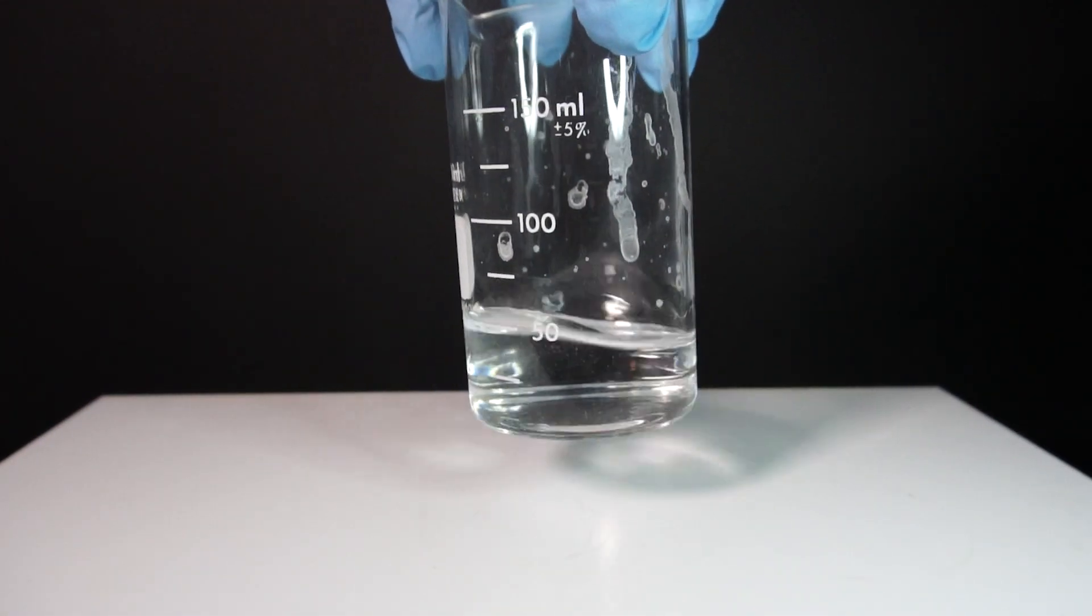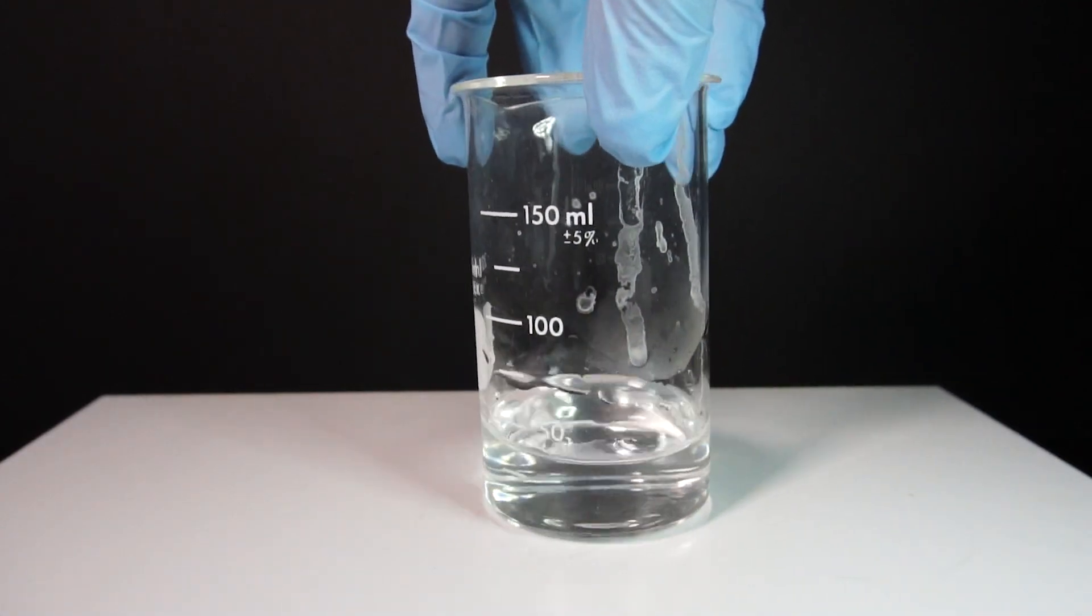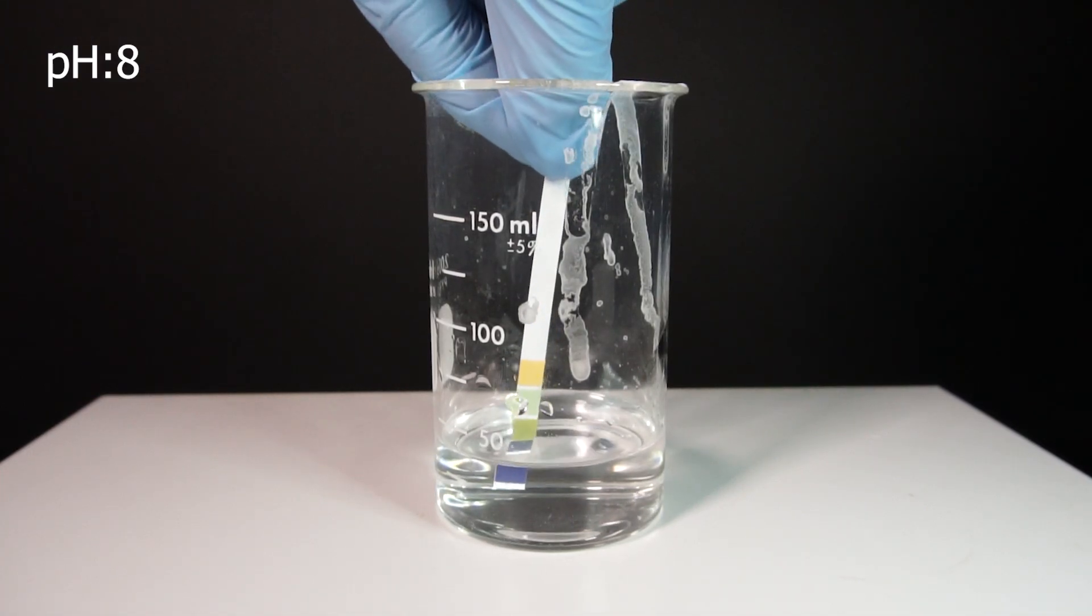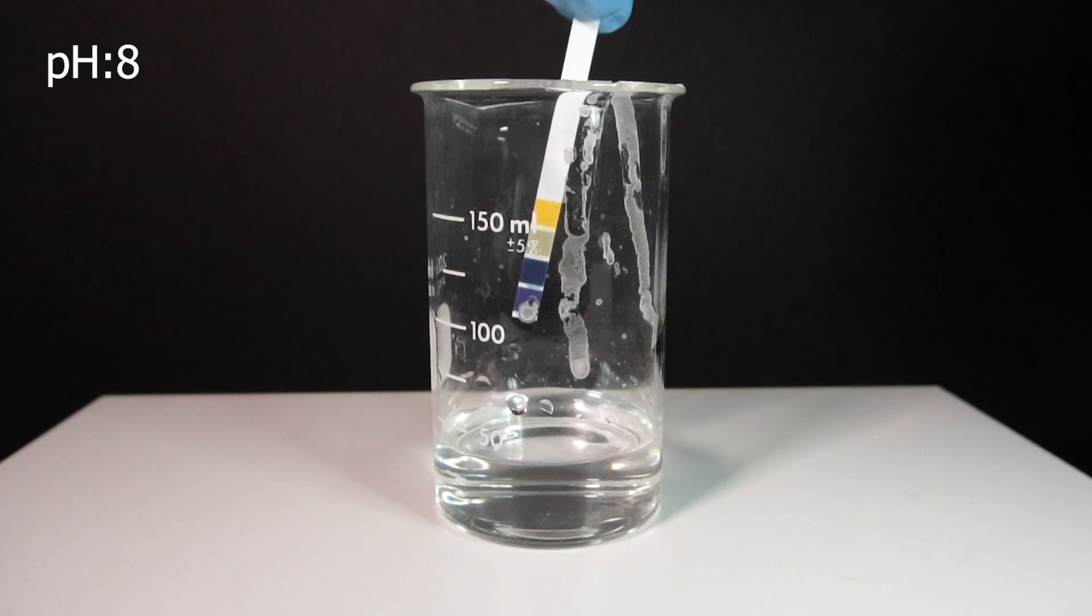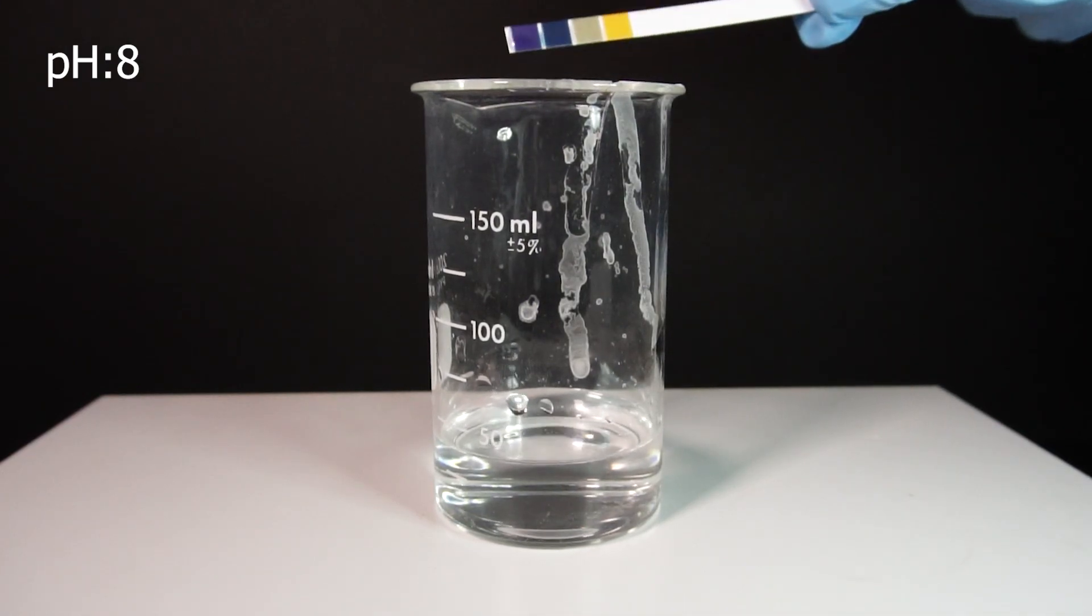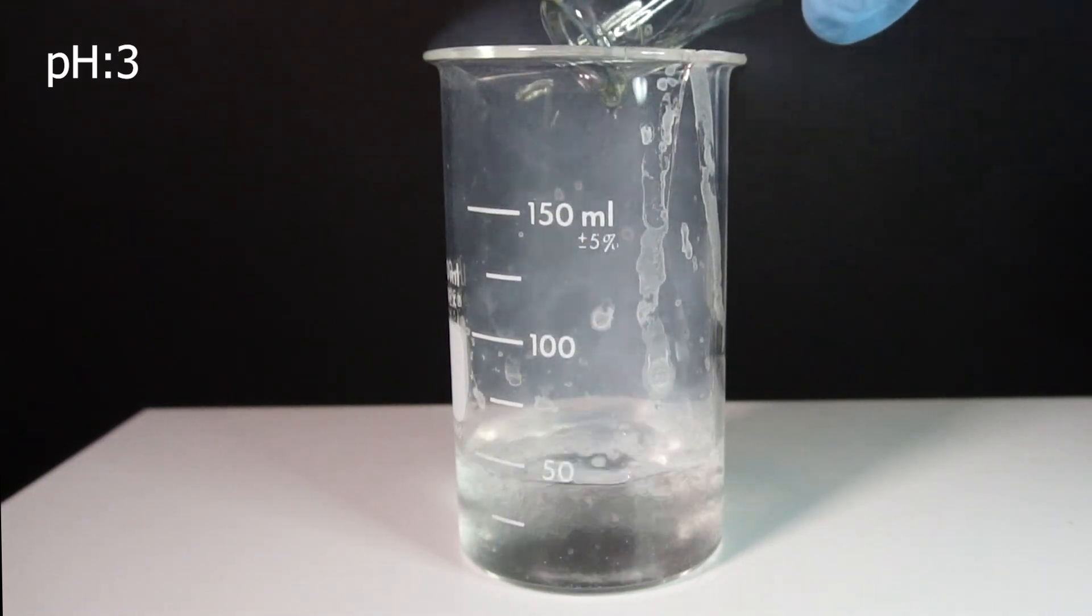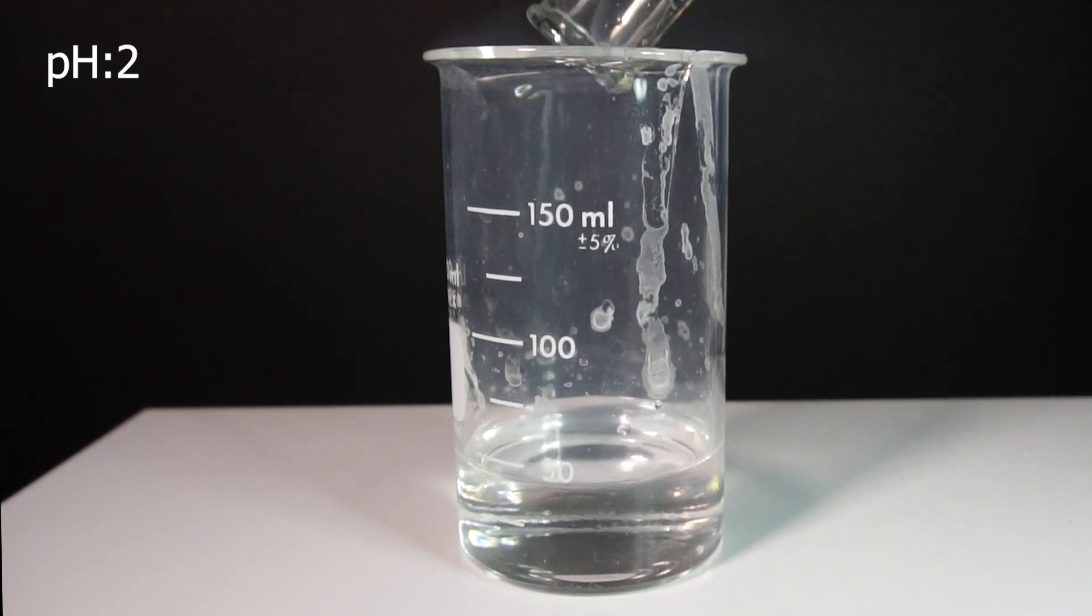After a little bit, I mix the solution to try to make sure the reaction is finished. The only way to actually check if it's finished is to measure its pH and then add accordingly. This doesn't really matter though because you will end up boiling off any of the excess acid or ammonia either way. But for the sake of this video, I will get my pH to around 7 after something like 4 adjustments.